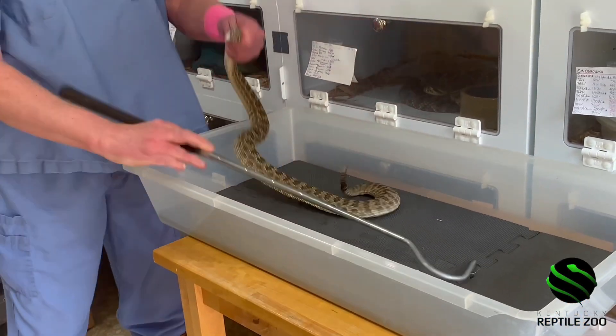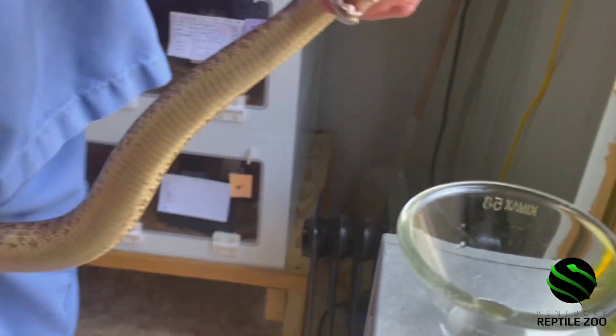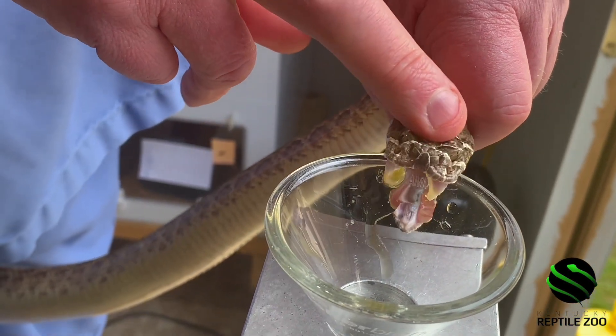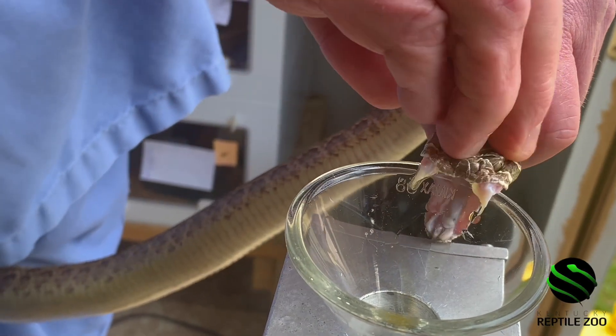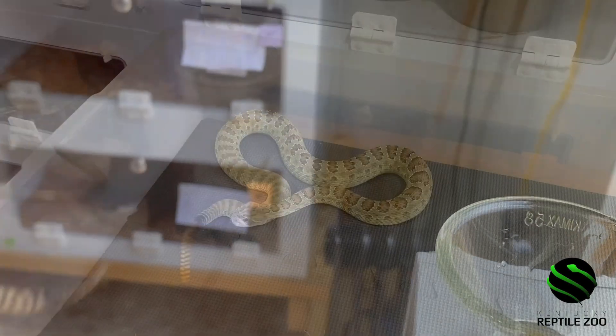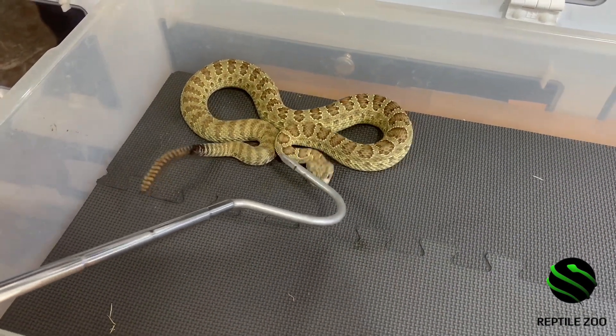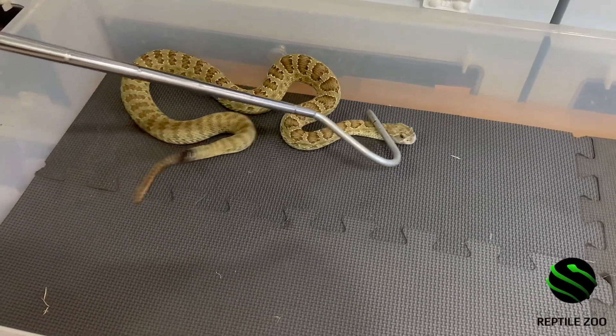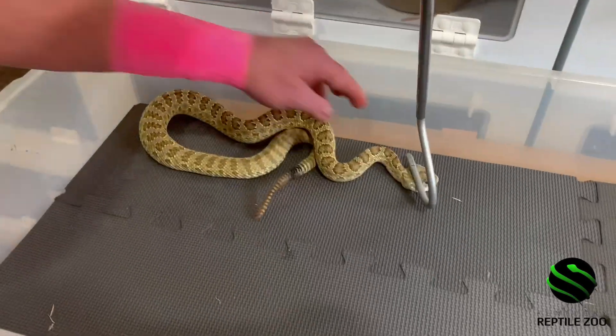Short little jab. The rattle itself is made of keratin — like when we break our fingernails or cut our hair. You can cut a long rattle. To me, this is a greenish rattlesnake, and this is not a Mojave. It is a prairie or a western rattlesnake.